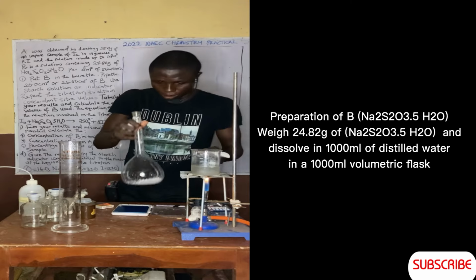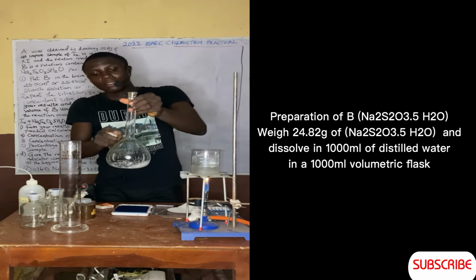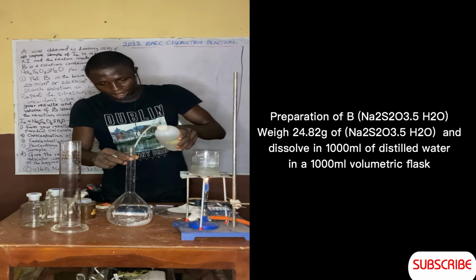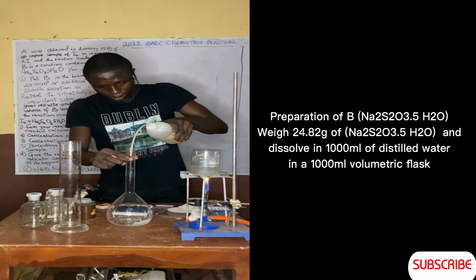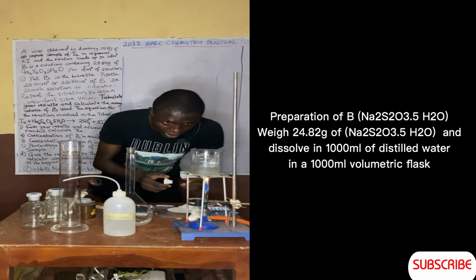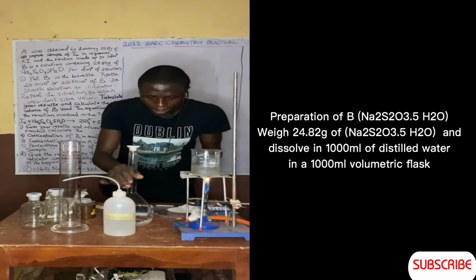So that's it. Then let's dissolve it in distilled water. You have to fill it to the brim, but before that, let's use this to rinse it first, so that nothing stays in it. Now let's fill it with distilled water. So this is going to 5 minutes now. Let's put this down. It's up towards 5 minutes.